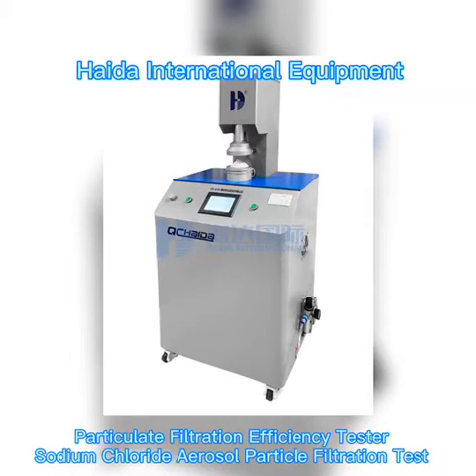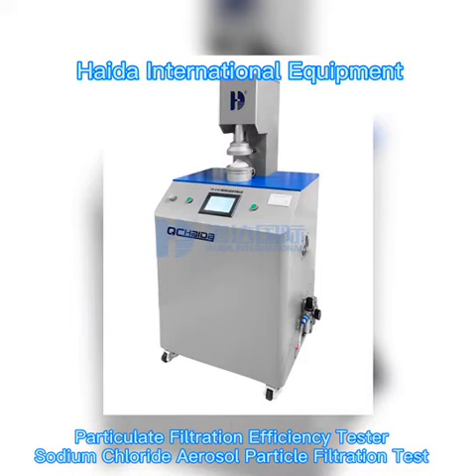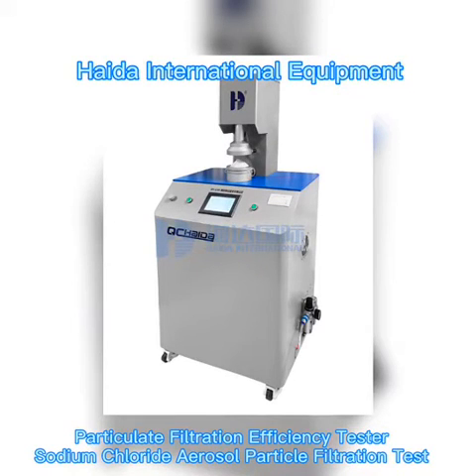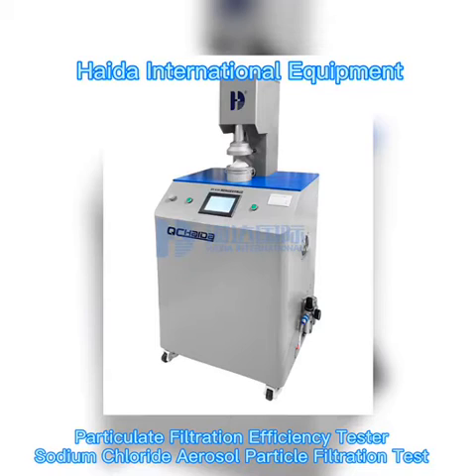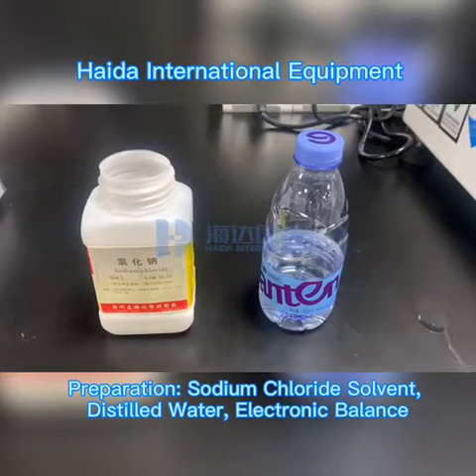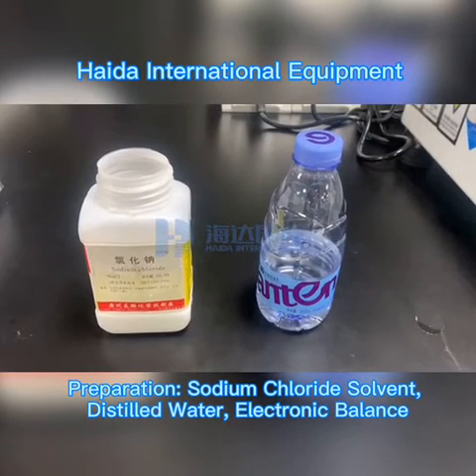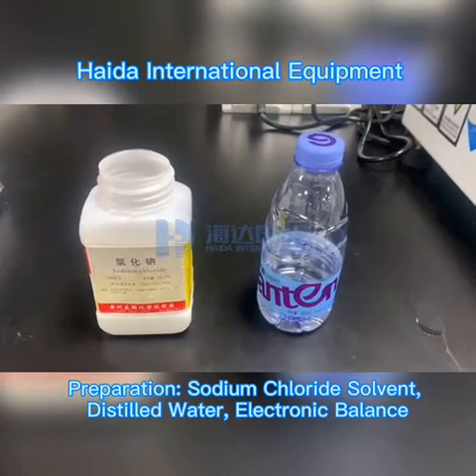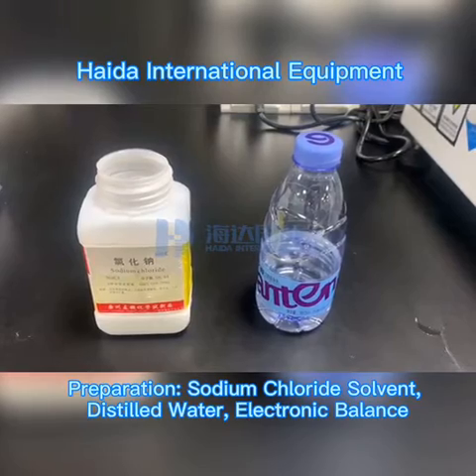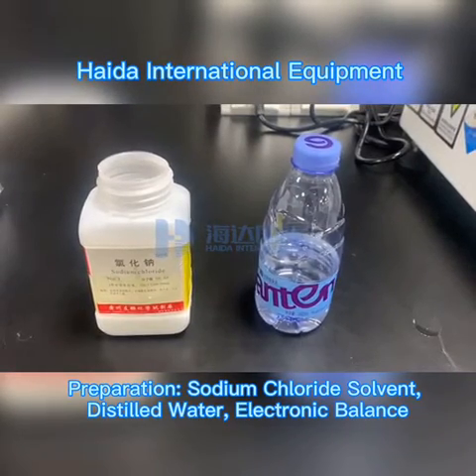Particulate filtration efficiency tester, sodium chloride aerosol particle filtration test. Preparation: sodium chloride solvent, distilled water, and an electronic balance.